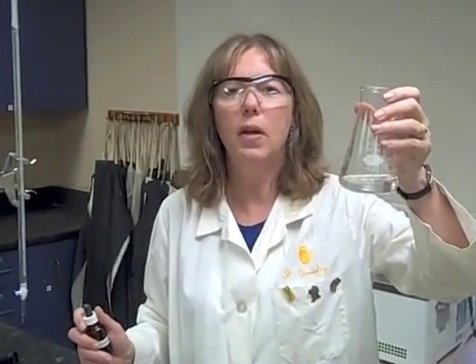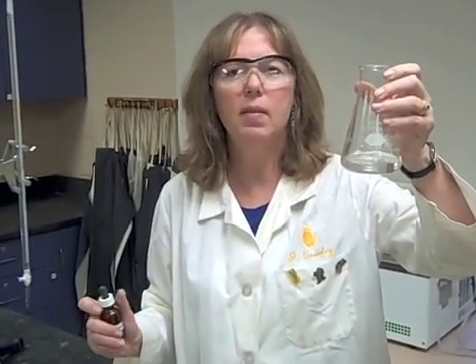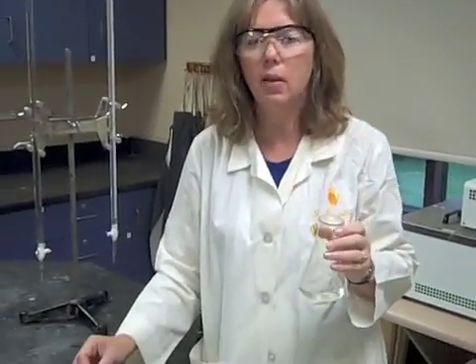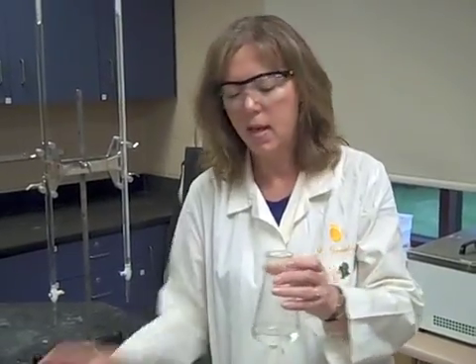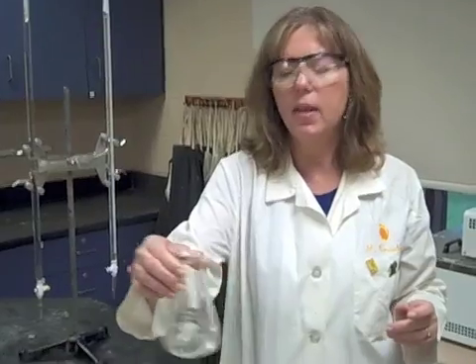Now, depending on how many drops you decide to use, I recommend one to two drops depending on the strength of the indicator. I'm going to use one drop in here and it should be colorless. Remember phenolphthalein in acid and in water is colorless. I'm going to swirl that, make sure that everything is really mixed before I get ready to do the base titration.